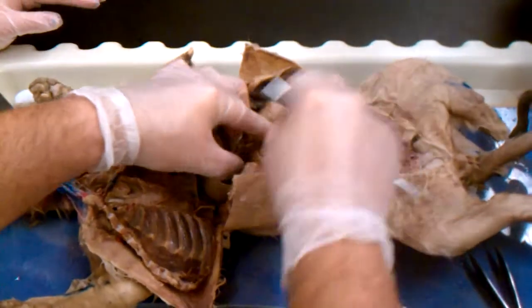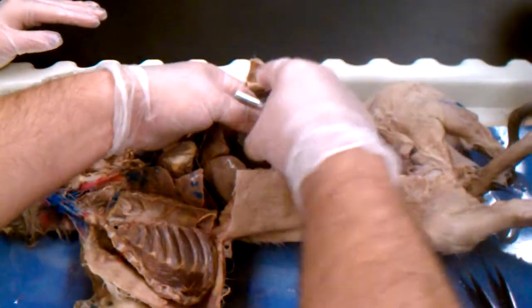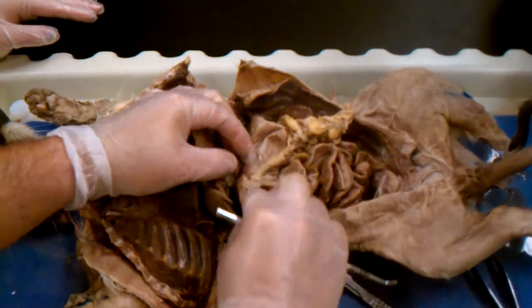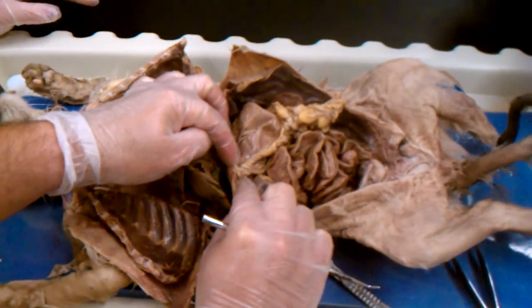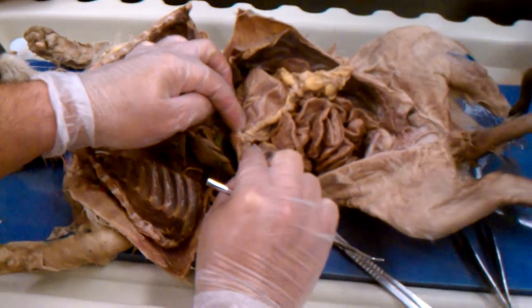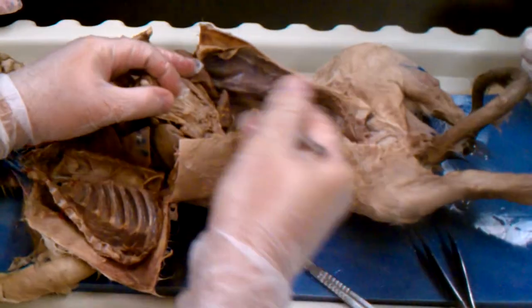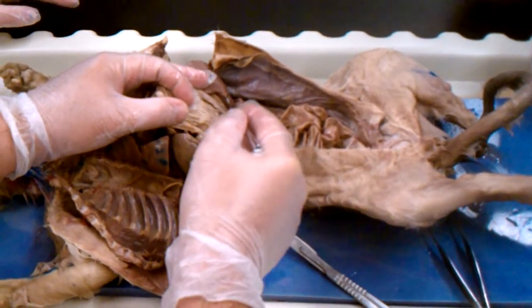Okay. So if we say name this valve, it is the pyloric. Perfect. Where the stomach and the small intestine connect. Pyloric. And they may ask you again about the pancreas, at the base of the stomach, where the greater omentum is. If I put this together, you're going to find a picture frame. So let's picture frame it.